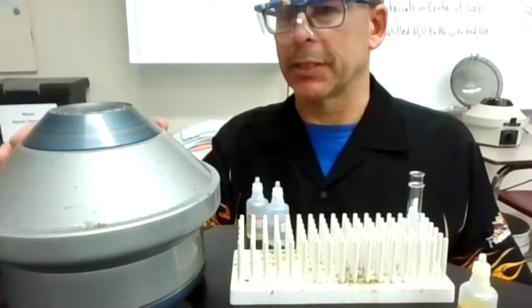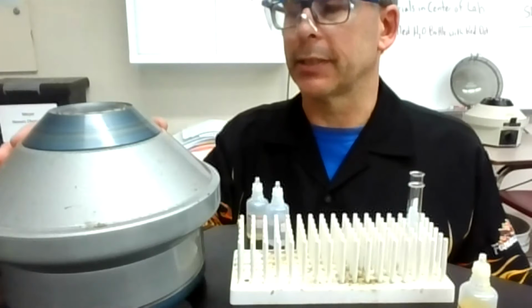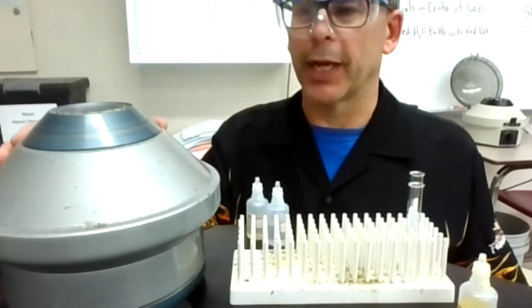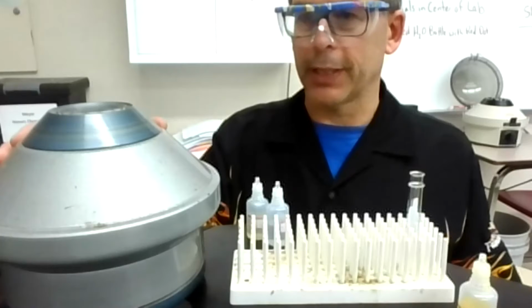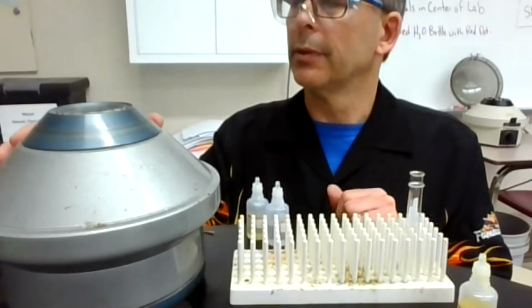And what happens is heavier things go to the outside. Just like if you're at Valley Fair and you spin around on one of the rides, the centrifugal force is going to force you, which are heavier than air, to the outside. So the precipitate should go to the outside, allowing me to separate that. Hopefully that's the case. Otherwise, I'll have to mix and re-spin.